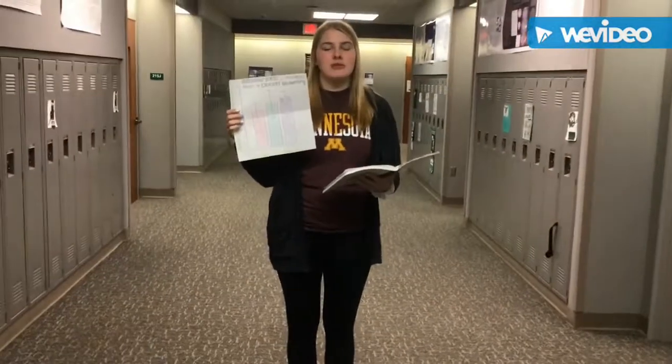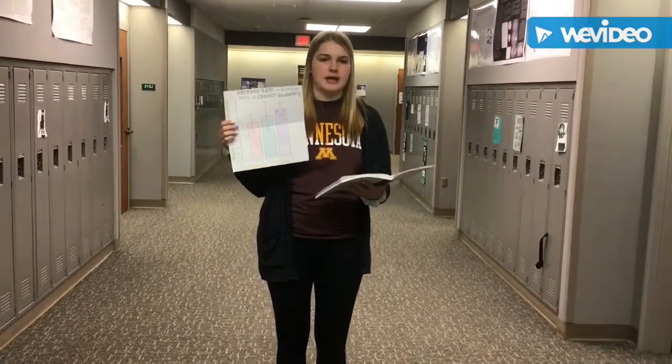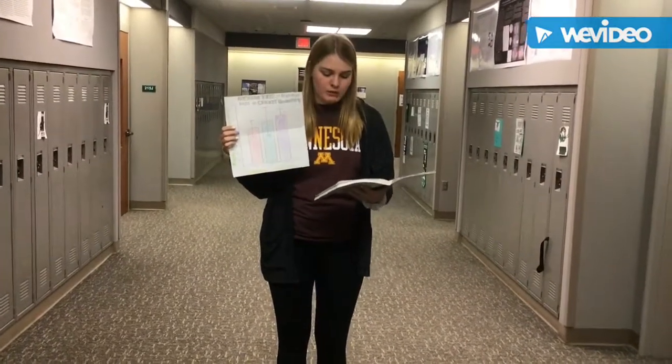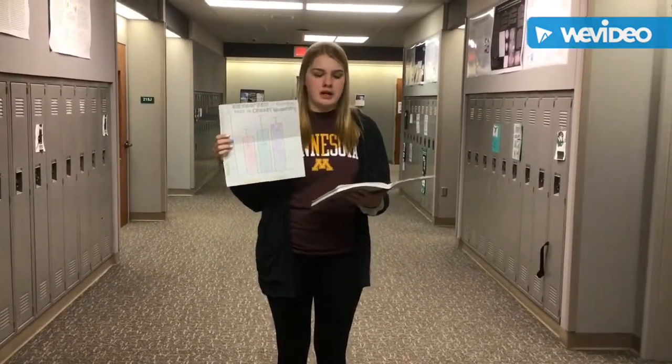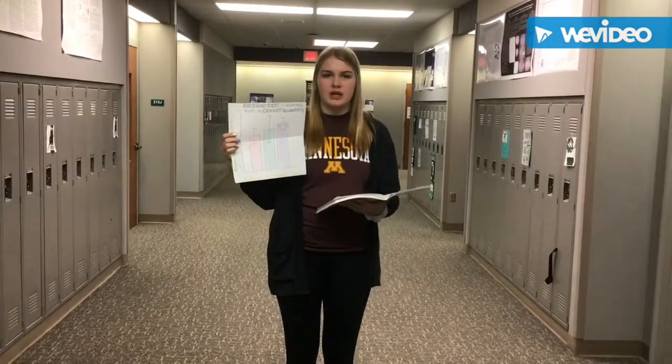The purpose of this lab was to use a CO2 sensor to measure the concentrations of carbon dioxide gas produced by crickets. Our hypothesis stated that if more crickets were present in the chamber, then the initial rate of carbon dioxide gas will be faster. Our hypothesis was proven incorrect.